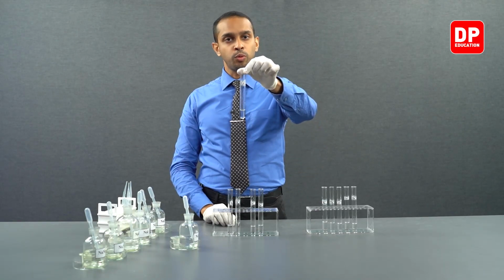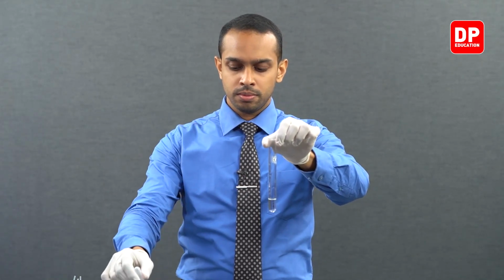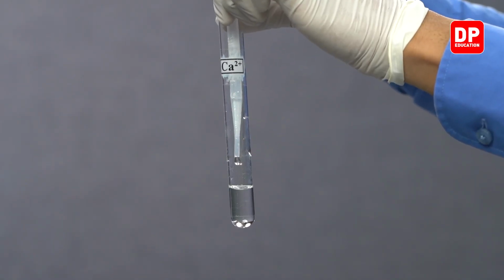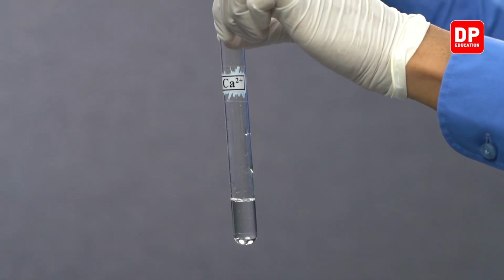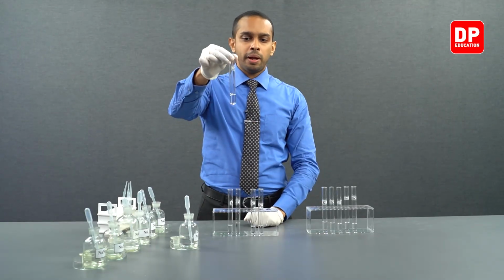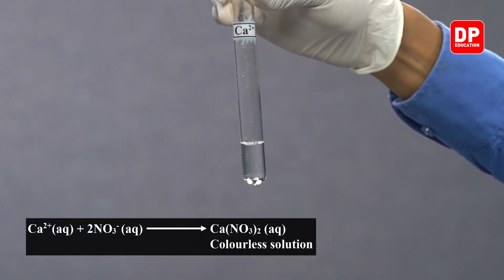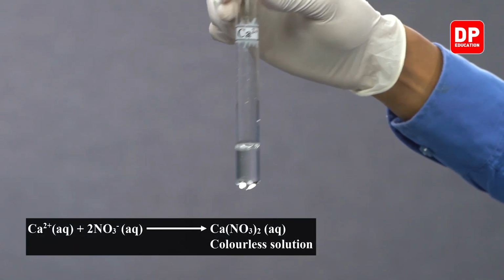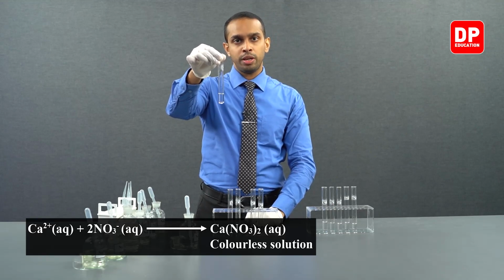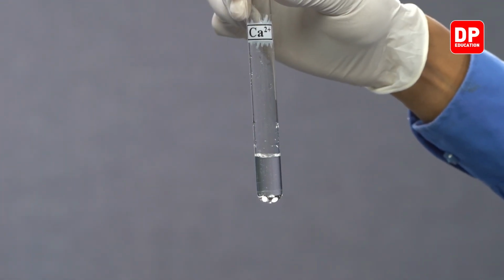Now, let's move on to calcium 2 plus aqueous solutions. Let's add a small amount of nitrate ion solution into calcium 2 plus. Calcium 2 plus, when reacted with nitrate ions, will form calcium nitrate. Calcium nitrate is also very soluble in water, so therefore you will not see the formation of a precipitate here as well.